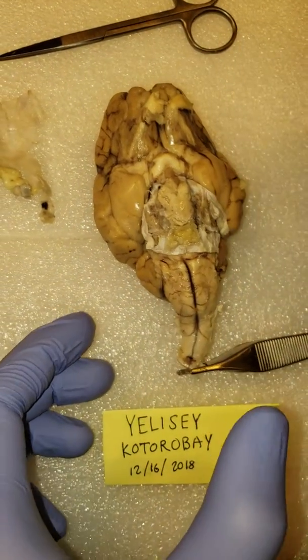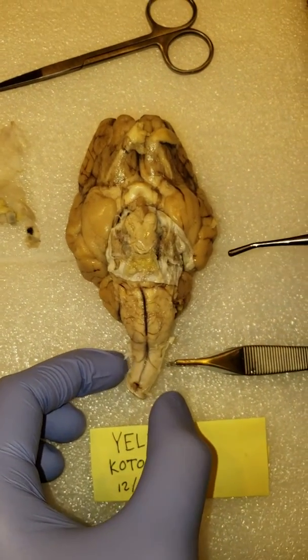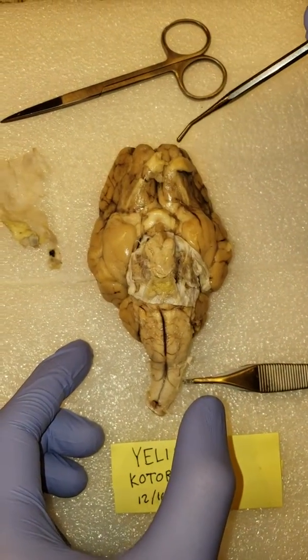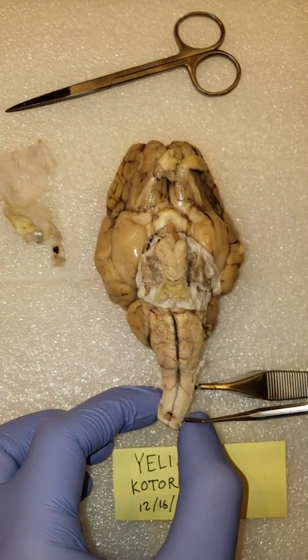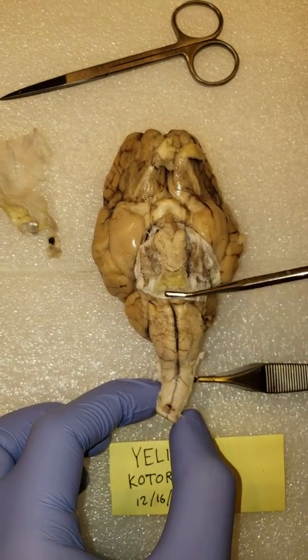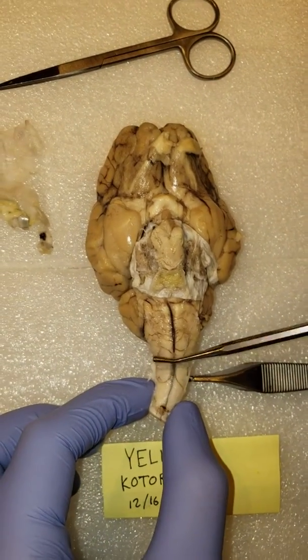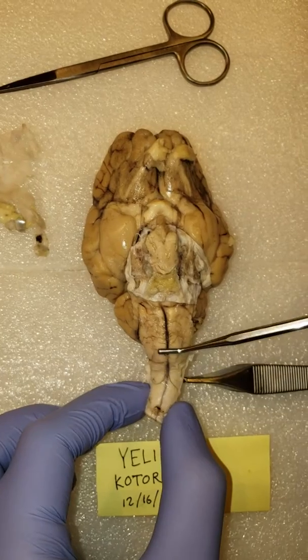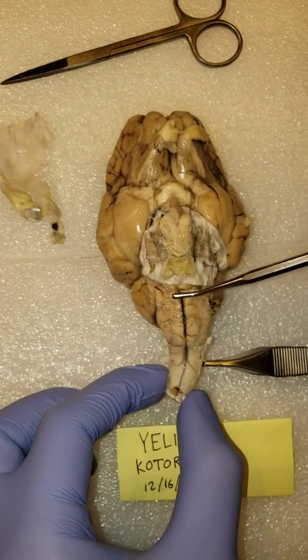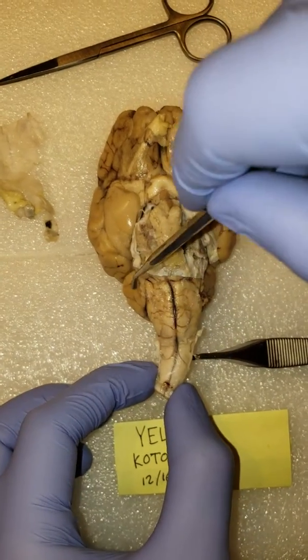And we'll just go through the same kind of step-by-step labeling, for lack of a better word. We can still see some of the lobes, like the temporal lobes at the sides, the frontal lobes at the very top, the brain stem at the very bottom, but we also have various little bumps. Certain parts of this area have different names. Unfortunately, unlike in textbooks, there's no clear-cut lines of where the margins are. So I'm just going to estimate by little landmarks like bumps and lumps and other things around it. We can also see the cerebellum from the other side, or the bottom portion of the cerebellum.